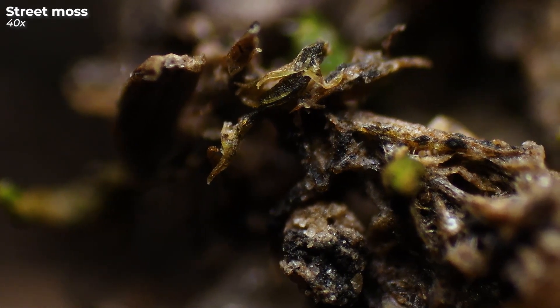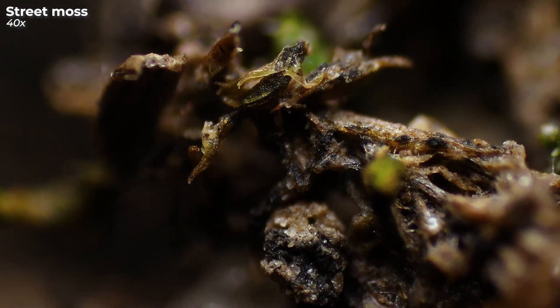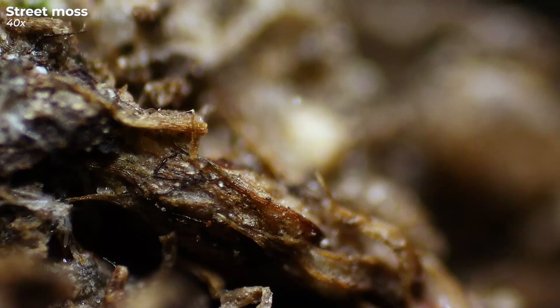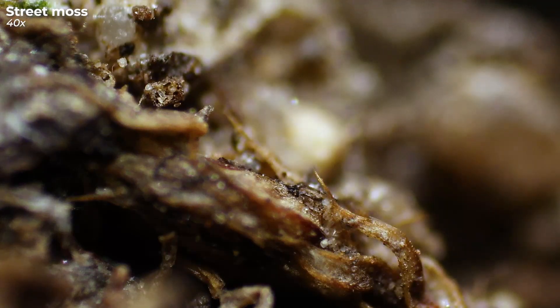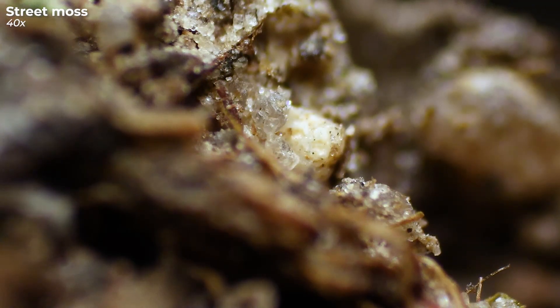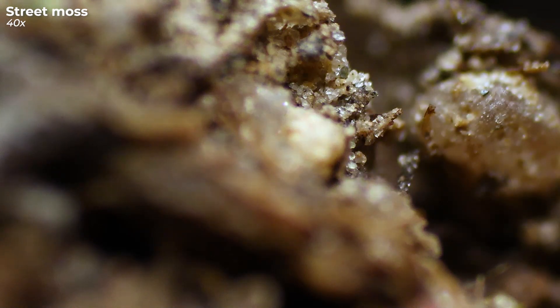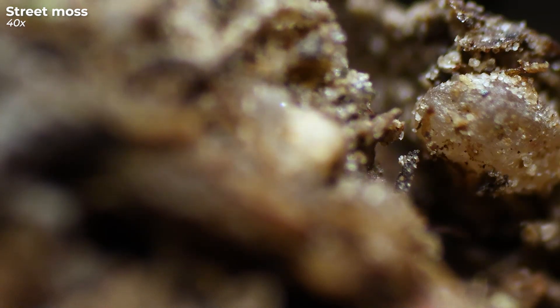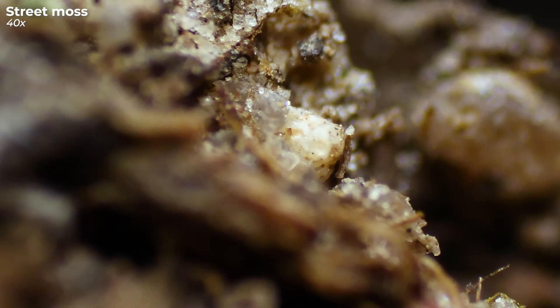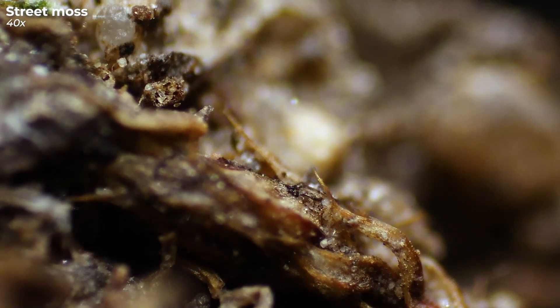However, rhizoids do not serve to absorb water and nutrients. Instead, moisture is absorbed directly into the cells by osmosis. The main function of rhizoids is to attach the plant to its substrate.